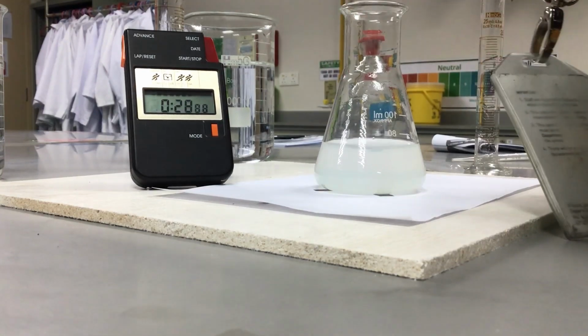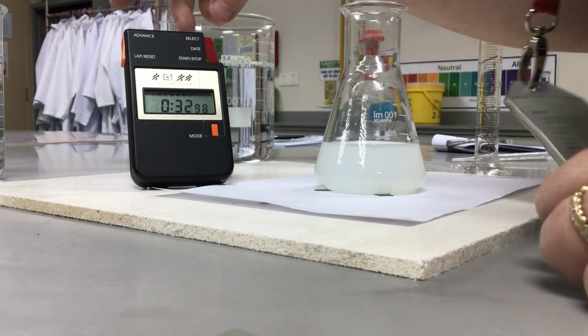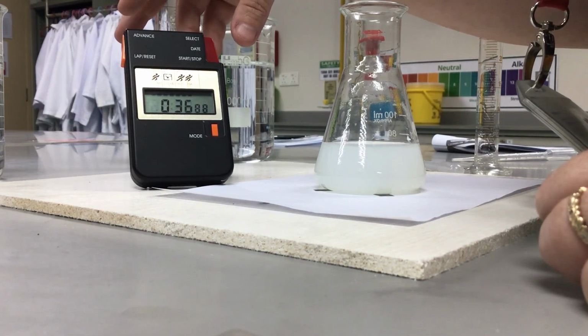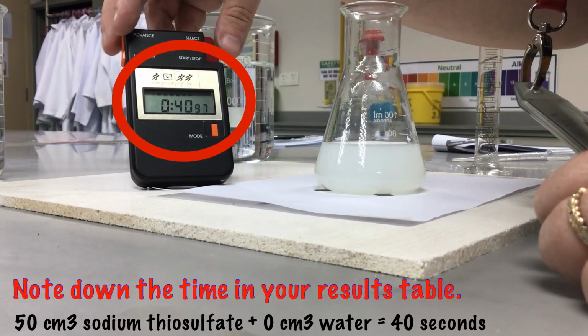So I'm going to stop swirling now. I'm going to get ready on my stopwatch. I'm going to wait for it to disappear fully. And it's gone.